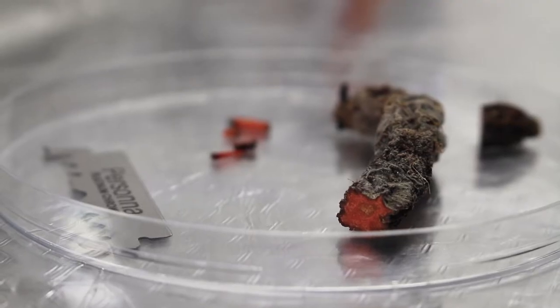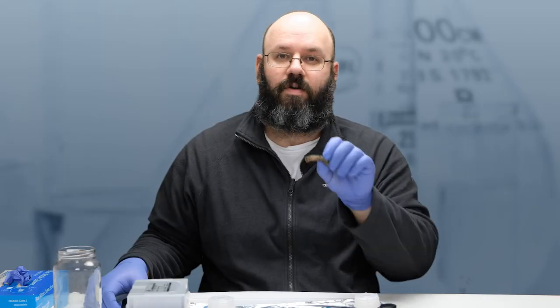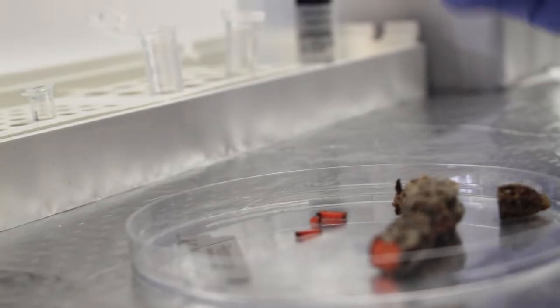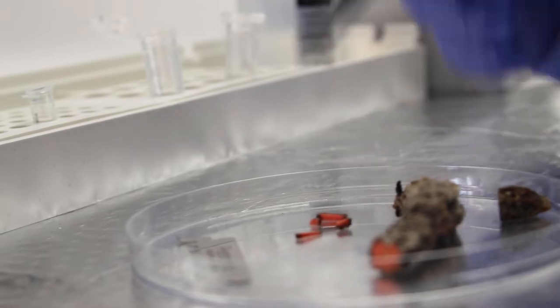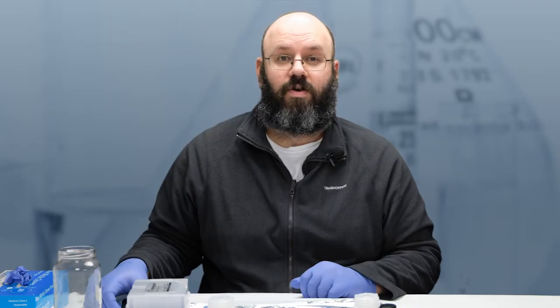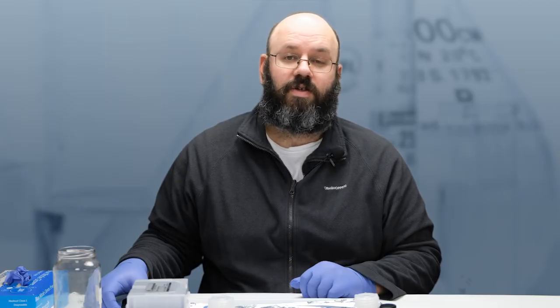In this demo, my sample is a carrot which has been colonized by a mold. I've already cut a small sub-sample using a sterile razor blade. Make sure that your sample size is only a few cubic millimeters, otherwise it could cause the extraction or PCR to fail.